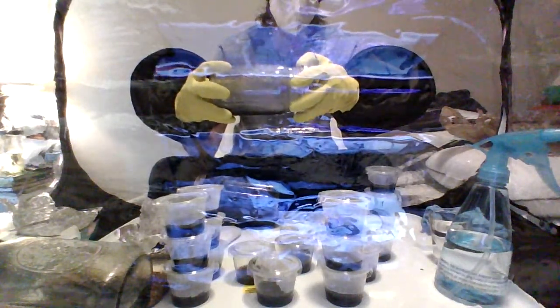So here's a quart mason jar that we're using as an agar dish. I let it solidify at a slant, so it's kind of like what they call culture slants, but that's not what it is. It's just agar. We want it dried on its side so we can easily access it, because otherwise you have to get it out of the bottom of the jar, and that's a hassle. I'm going to leave the metal part on there for now. Since it's solidified, set it up straight. All right, here we go.